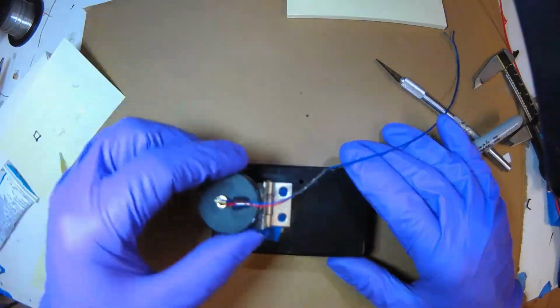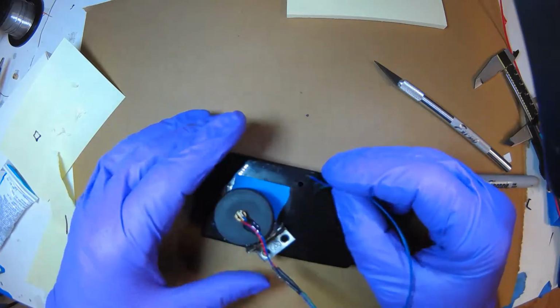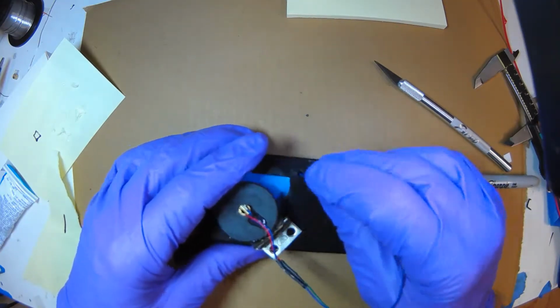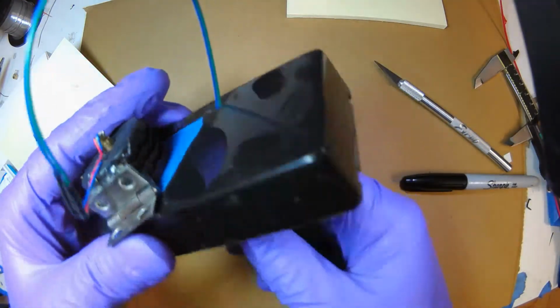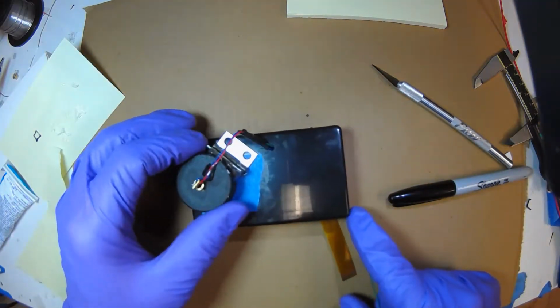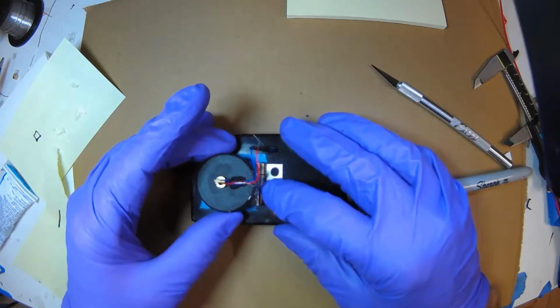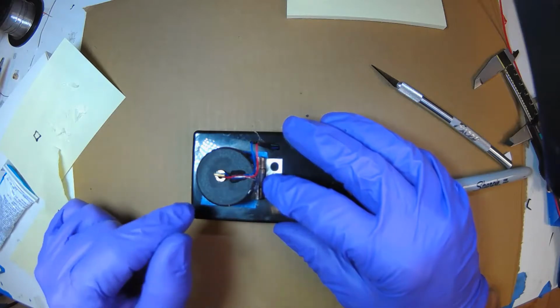Okay, I just drilled a hole, so it's going to basically go through here. I used a Dremel, and the wires go through here. And once we do the final assembly, I'll tack down the wire so it's nice and neat. But just right now, all I have to do is get it loose so that I can position this when it's on to align it, and then glue this down.